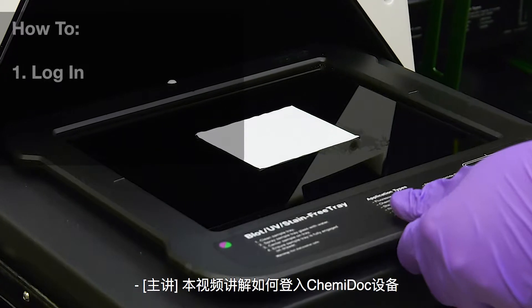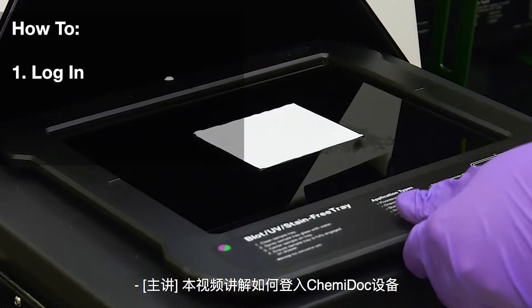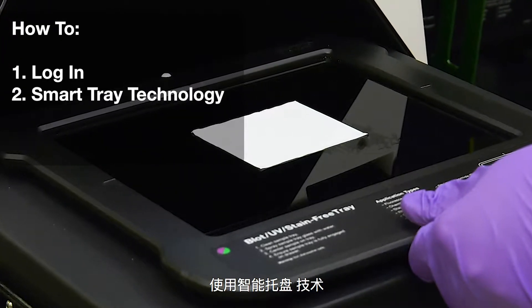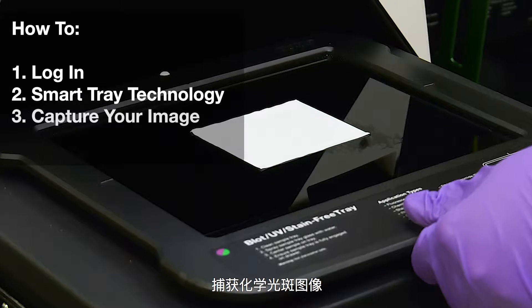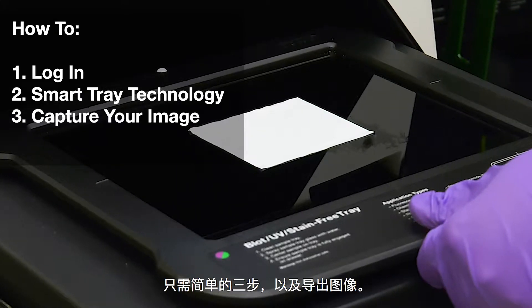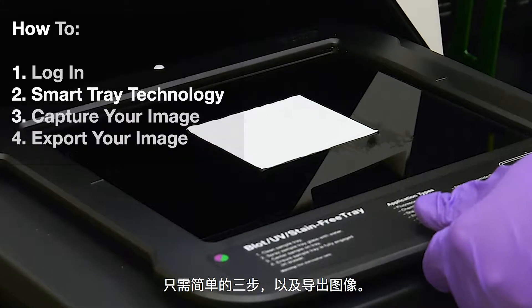In this video, you'll learn how to log into your Chemidoc, use SmartTray technology, and capture chemiluminescent blot images in three easy steps and export them.